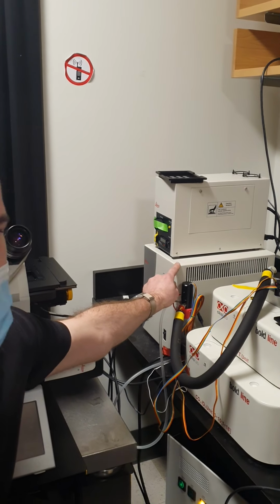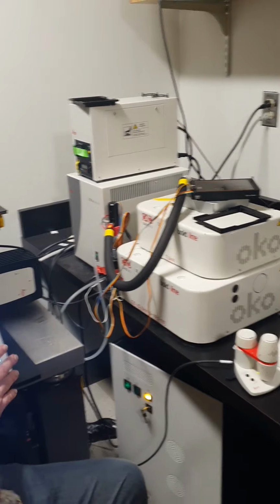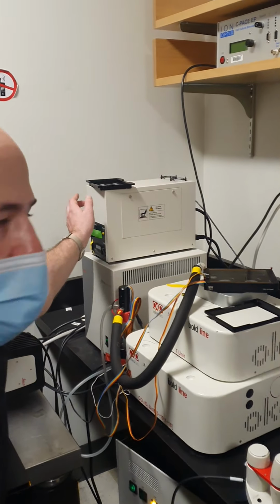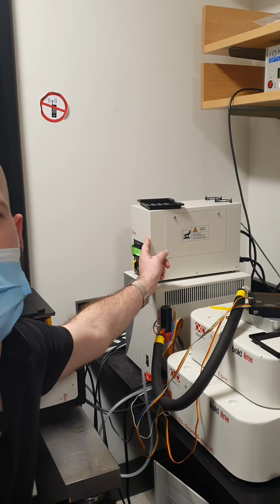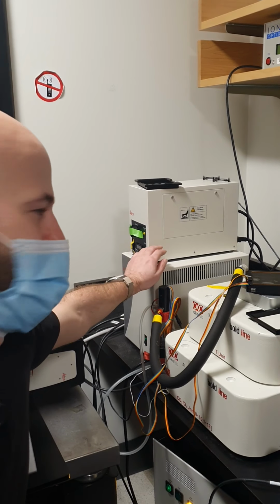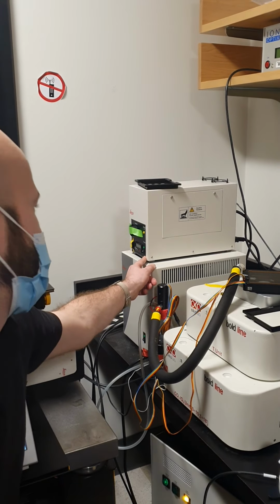This is basically the interface between the microscope and the computer, and it's just a single switch in the front there. And when we turn that, we'll see that the microscope starts to turn on. And then the last thing, which is optional depending on what type of imaging you're doing, is this here, which is the metal halide light for wide field fluorescence. So if you were just doing bright field like histology, you can leave that off and not wear out the bulb in there. But since we're going to be doing fluorescence imaging, we'll turn that on. And again, it's just a single switch in the front.